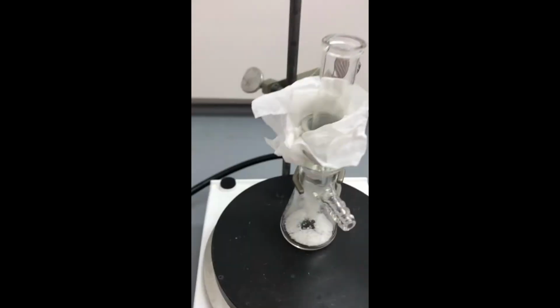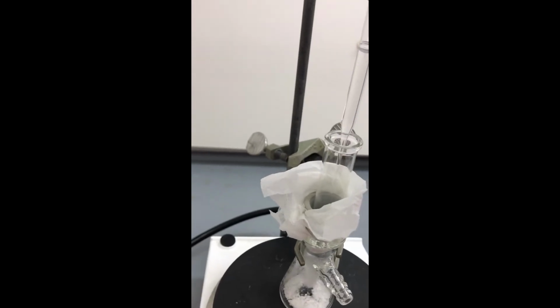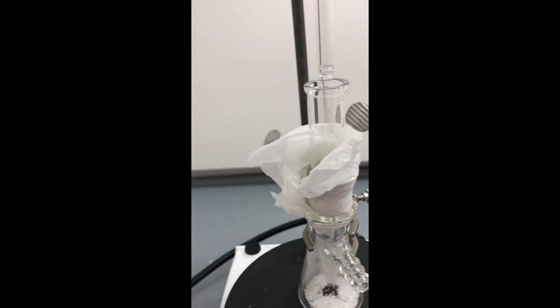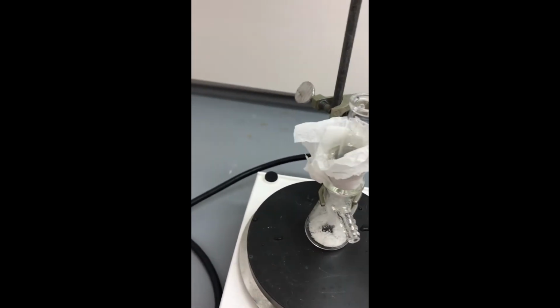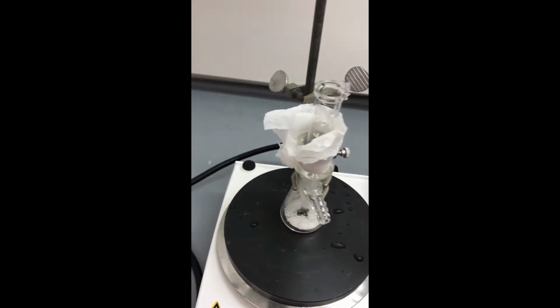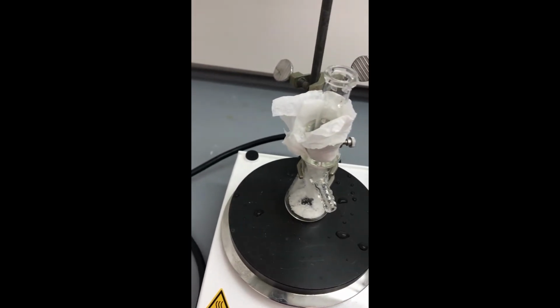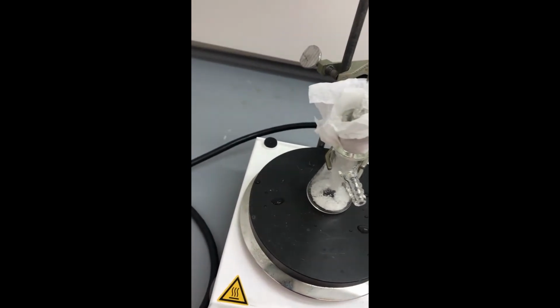Because the hot plate is heating the crystals, the ice in the cold finger will also melt. Use a pipette to remove the water from the cold finger and dispense it into a waste beaker. Once all of the water is removed, refill the cold finger with ice. We will repeat the crystal scraping and cold finger refilling multiple times until all of the crystals have sublimed and only impurities are left.